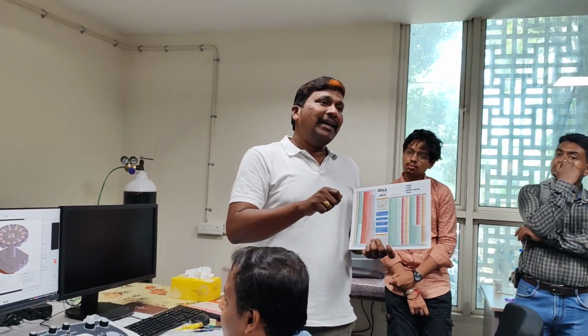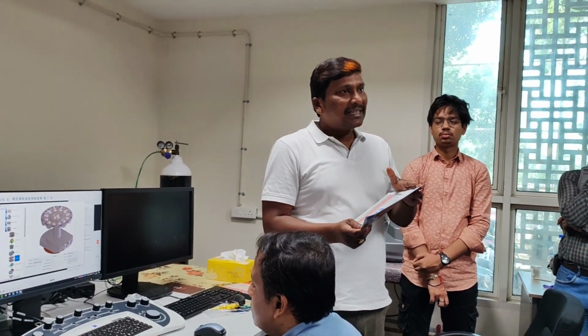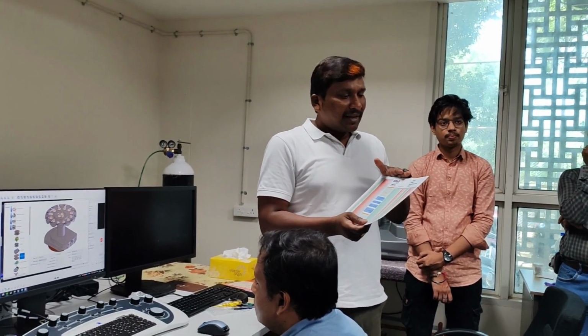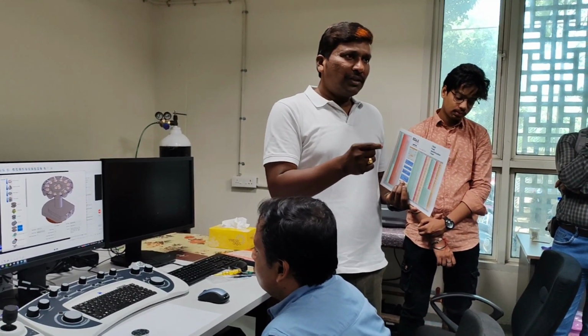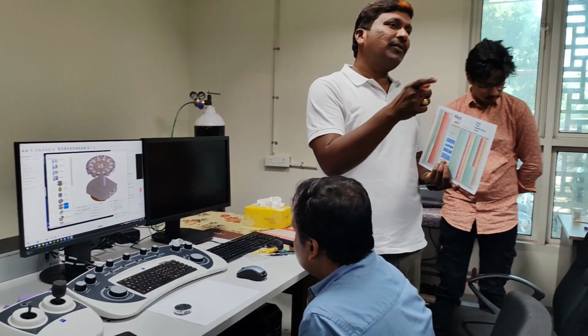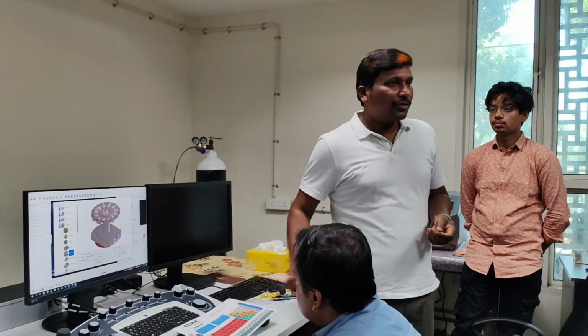We have so many samples, so it is better to cut with the diamond cutter, or whichever way you handle it, and then polish that surface so that the external stress which bends your sample or thin film is removed and it becomes flat. Use diamond paste of different particle sizes, polish it properly. Before that, you have to make a mold of that sample, then it is easy. I'll show you.